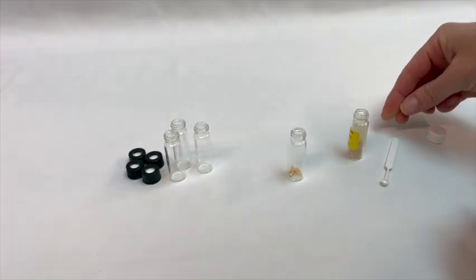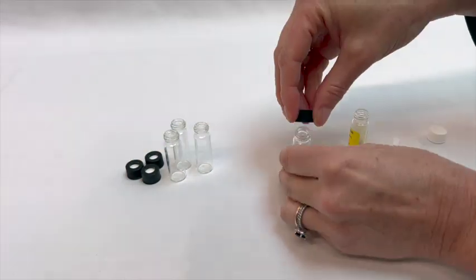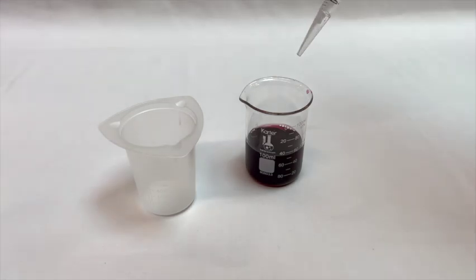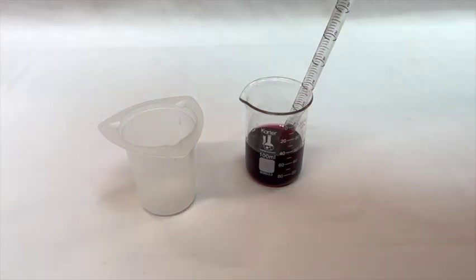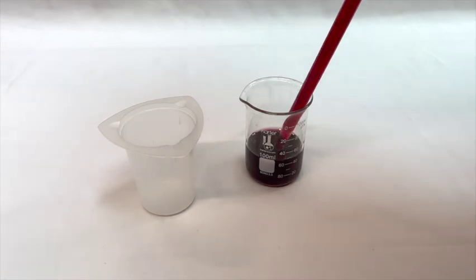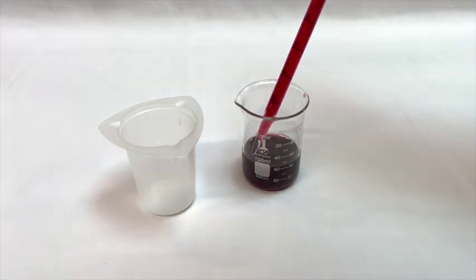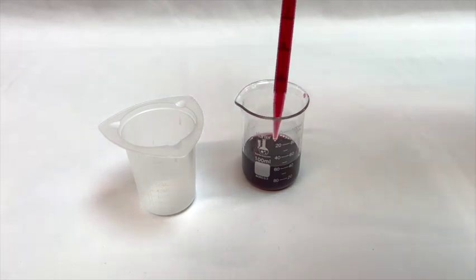Today, I will be running one wine sample. But since I will be demonstrating both the quick check mode and the quantitative mode, I will need an additional vial for each of the standards. Both the zero gram per liter standard, which is our blank, and the provided 0.4 gram per liter standard. So I have three vials in total.